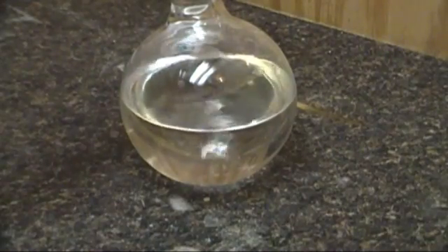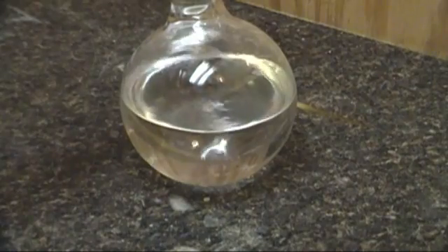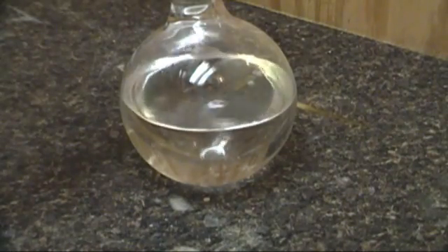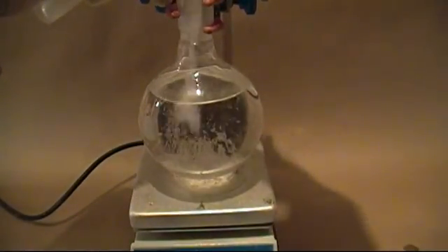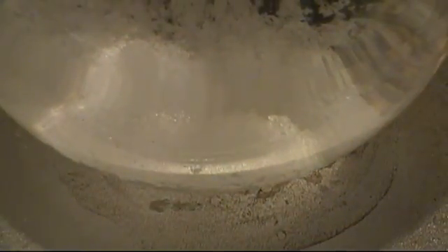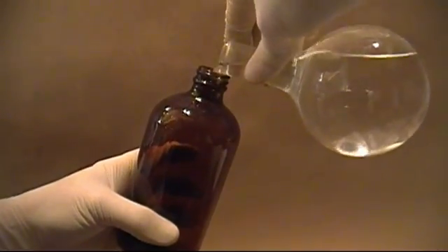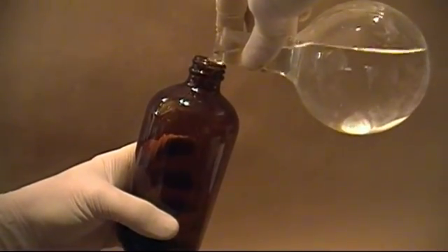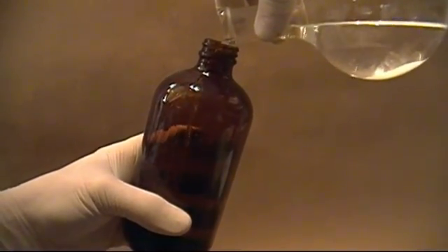This ether will have a small amount of ethanol in it. If you wish to remove it, you will need to perform a fractional distillation — this is unnecessary for my purposes. Place what you distill on a magnetic stirrer and add a magnetic stir bar. Now add about 30 grams of calcium chloride and stopper the flask. Let this stir for about 30 minutes — longer is better. This will remove any water. This is about as dry as we will need for any of my upcoming videos. Later, I plan to do a video on the Grignard reaction when we'll need very pure, very dry ether, so expect a video on ether purification in the future.